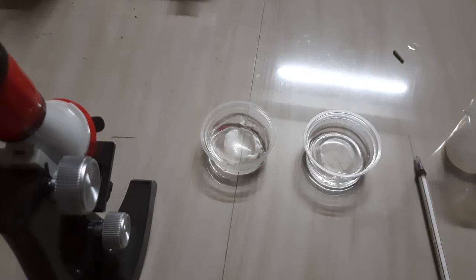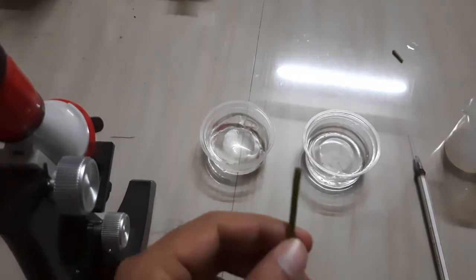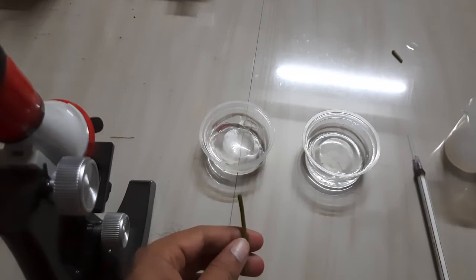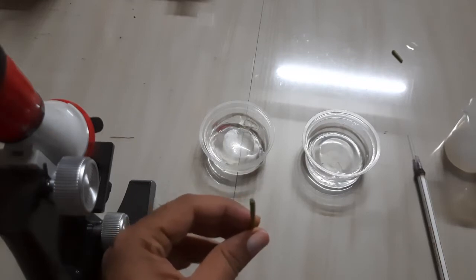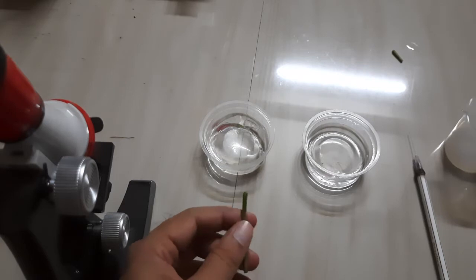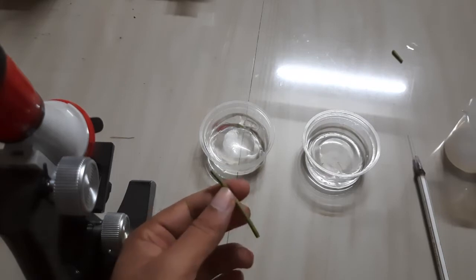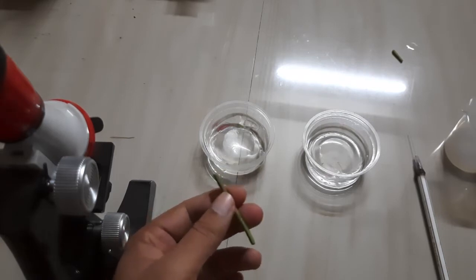For that purpose, I have taken a simple specimen — this is a stem — and I will show you how to prepare a transverse section of this stem or of this specimen.